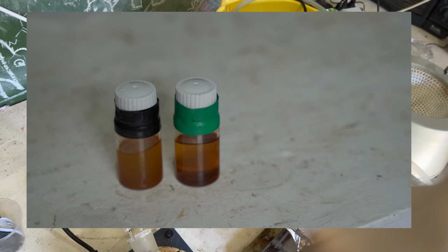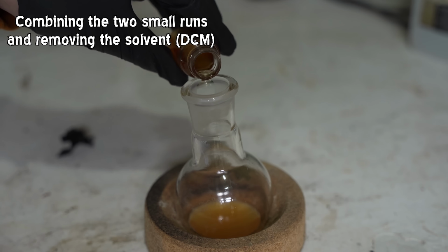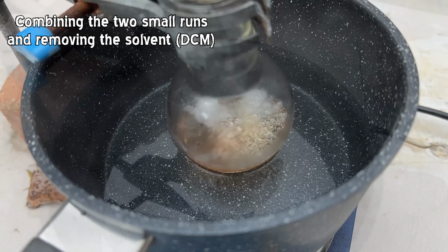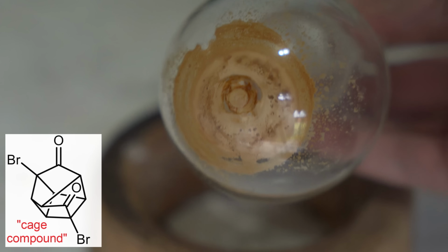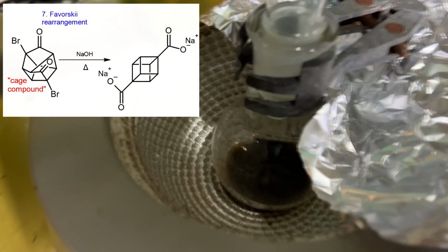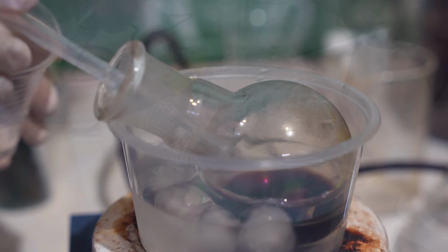I mean, it looked like it did the UV reaction properly as well, so there was no reason to throw that out. So I did the whole making Cubane process with those two solutions as well. Combined them, evaporated the solvent off to just leave us with that solid residue, which we then reflux for several hours in a sodium hydroxide solution. And it goes that sort of awful brownie color.